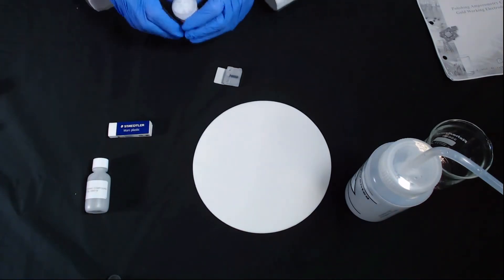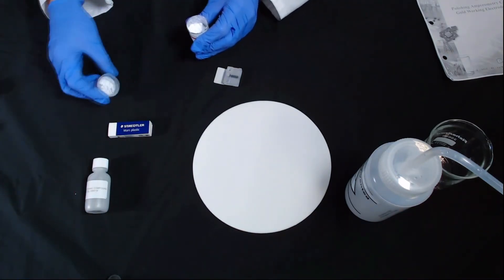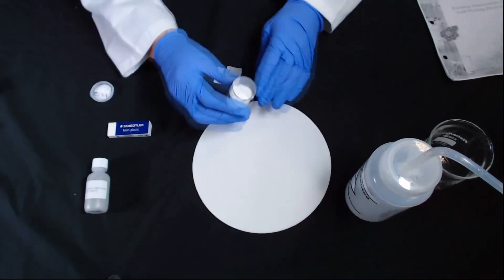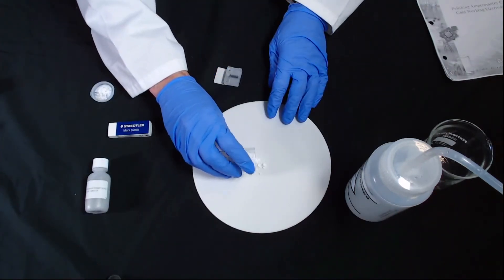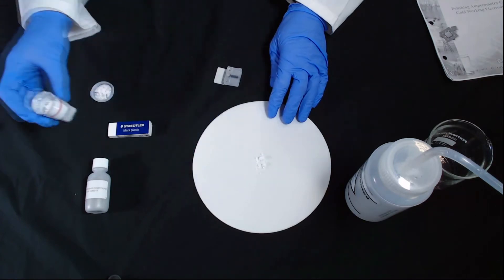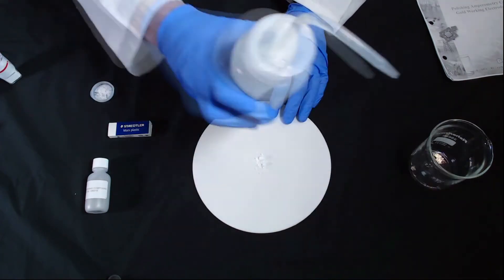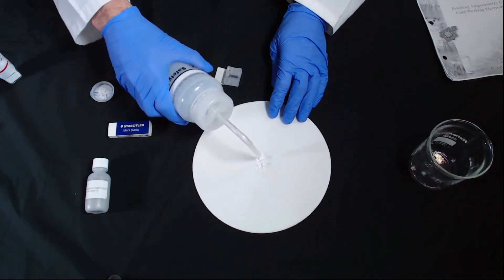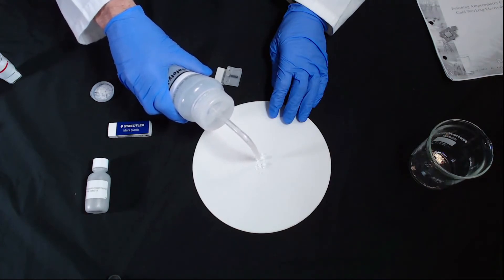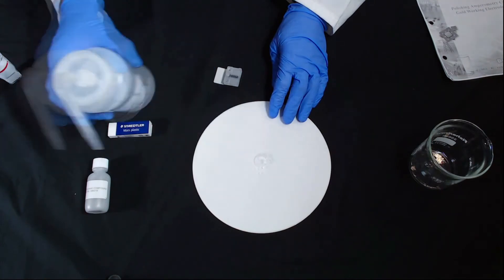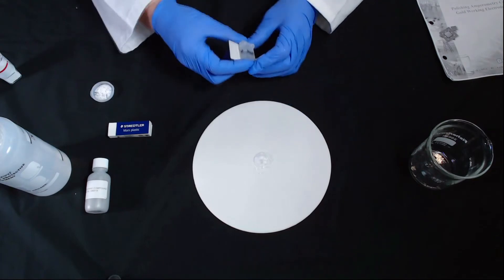I'm going to show you with a fine compound. I'm going to put a small amount of the powder into the center and add some deionized water to it with a wash bottle. That's going to form a paste.